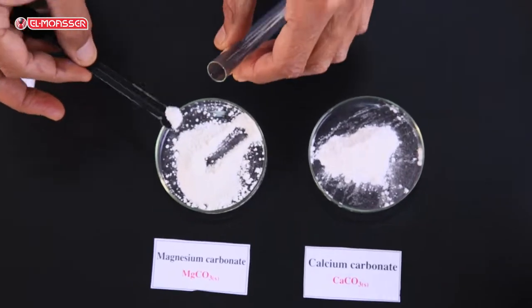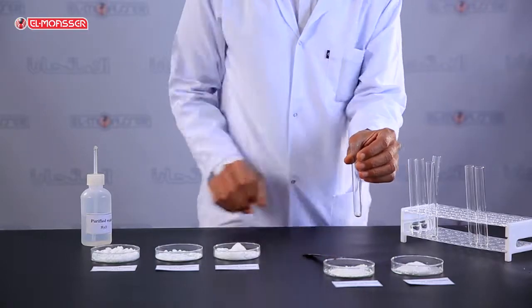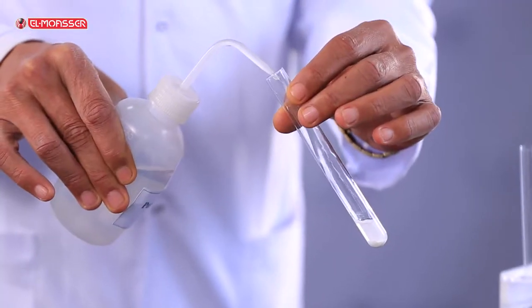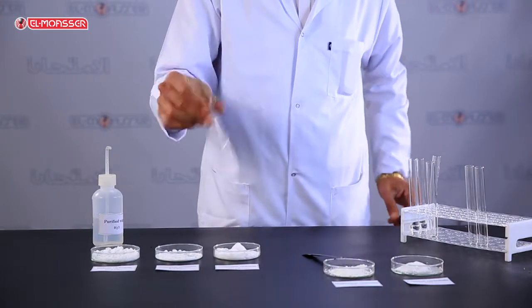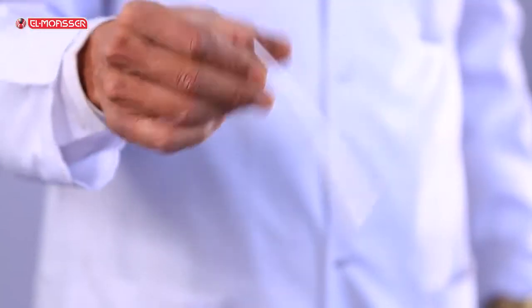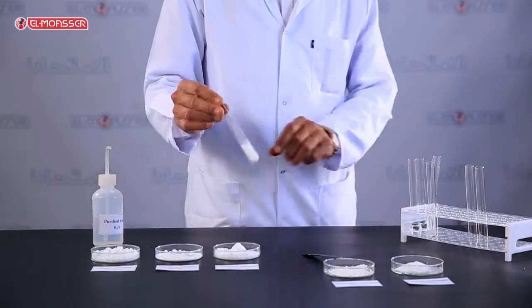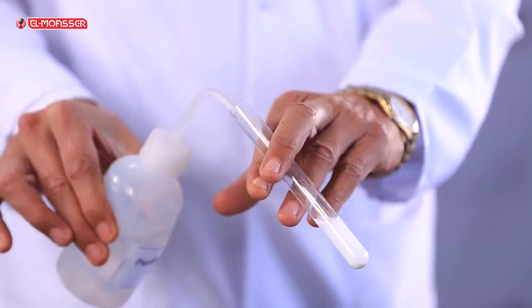Add a small amount of magnesium carbonate into a test tube, then add distilled water and shake. What do you observe? Magnesium carbonate is insoluble in water. To be sure that the salt is insoluble, add more distilled water.